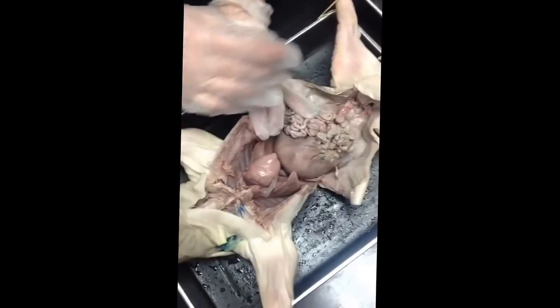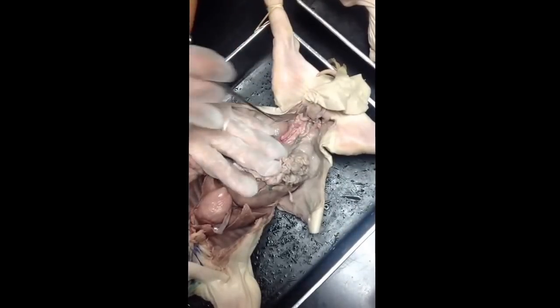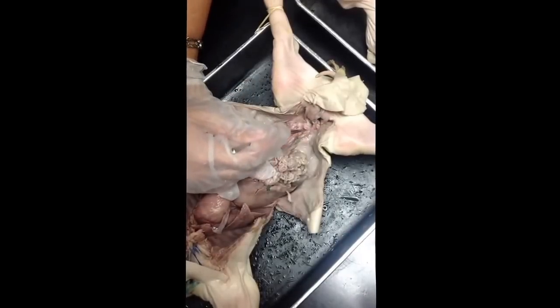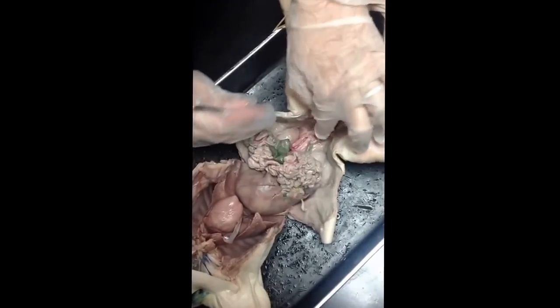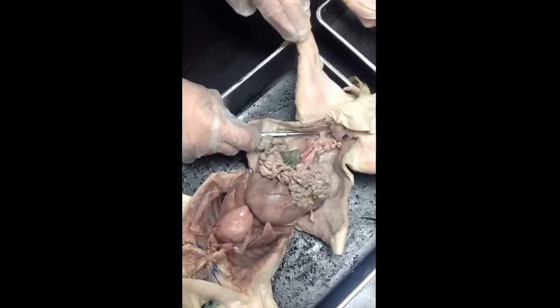Okay. The aorta is a little tricky to see. So the best way to see it is through the descending aorta in the abdomen. This large white tube that I'm pointing at, that's the descending aorta. And if you keep following it, here it is. It has a branch. It looks like a letter Y. It's a branch that goes into the leg. And so that's where the iliacs would be.